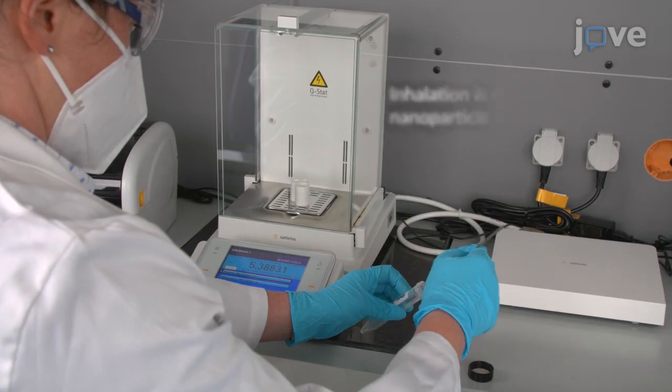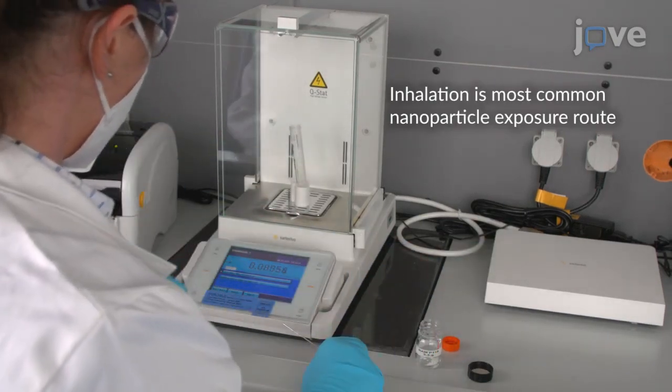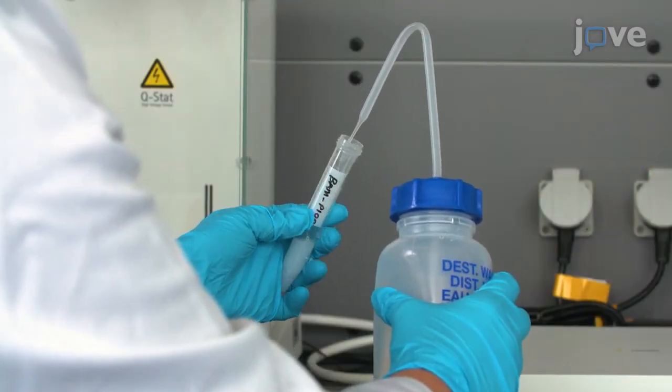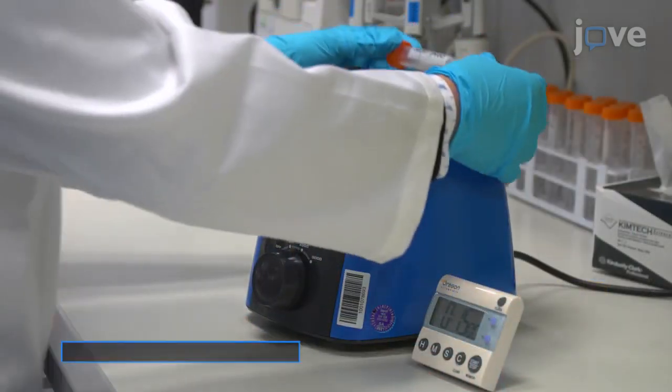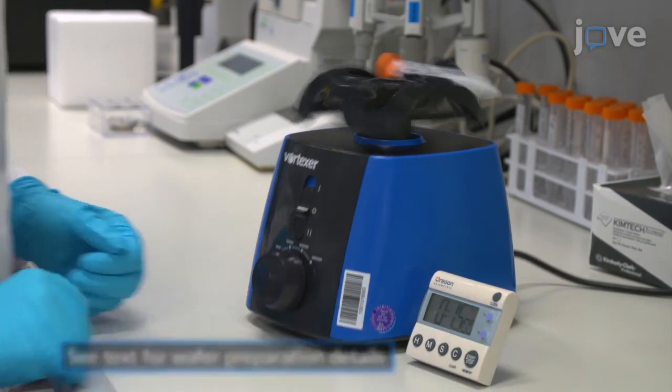For the preparation of nanoparticles from a suspension, weigh 15 milligrams of nanoparticle powder into a 10 milliliter tube, followed by the addition of 8 milliliters of ultra-pure water. After capping, place the tube in a vortexer at 3000 revolutions for 15 minutes.